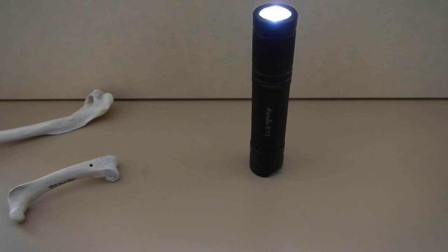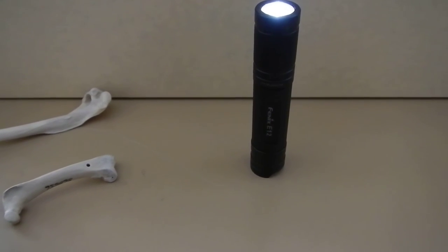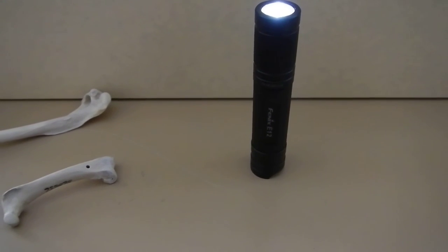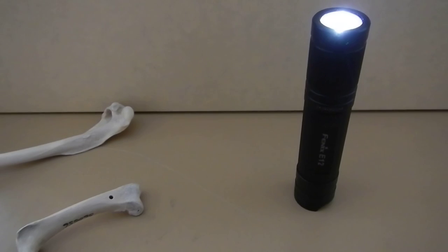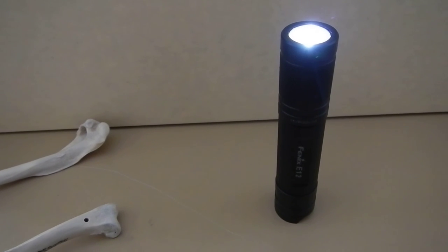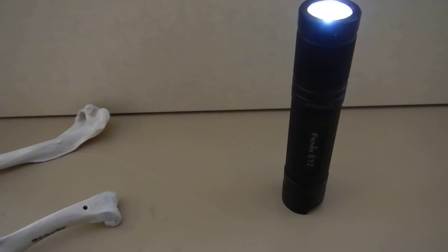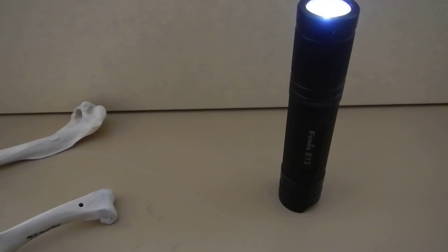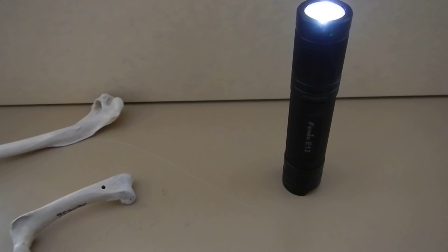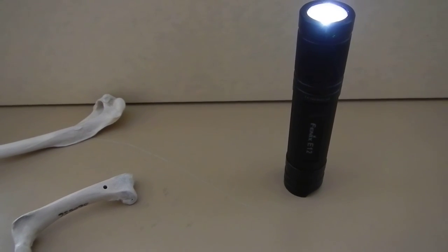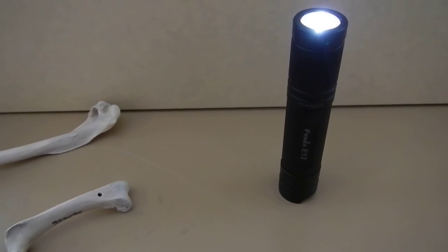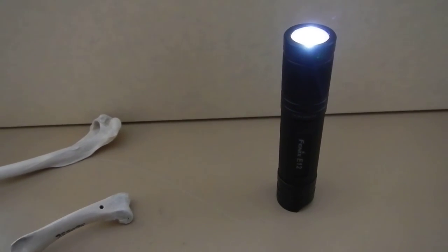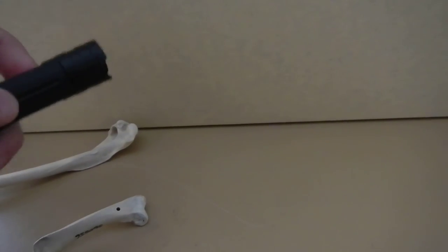It's best to do this in a room that's pretty dark or shaded. If you have a bigger bone, like something like an ostrich, you really have to make sure the marrow is completely drained out or it won't work at all. And for that you'd probably need a much more high powered light, like one of those gooseneck lamps that they use to highlight stereo microscopes.